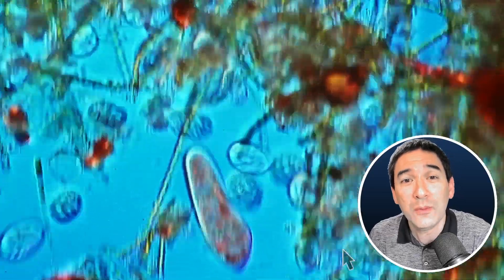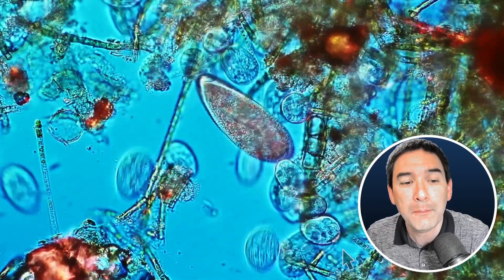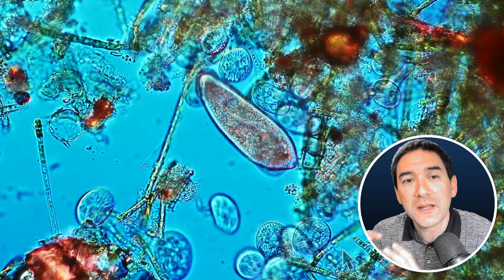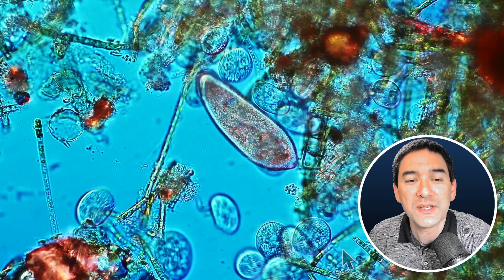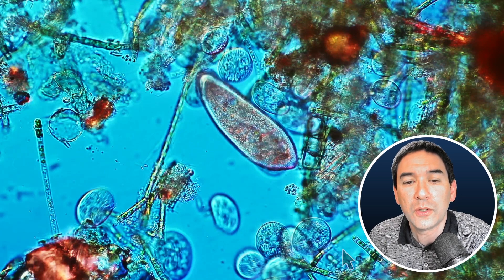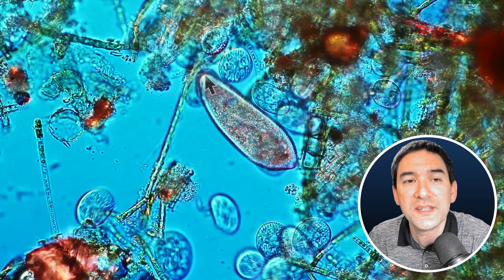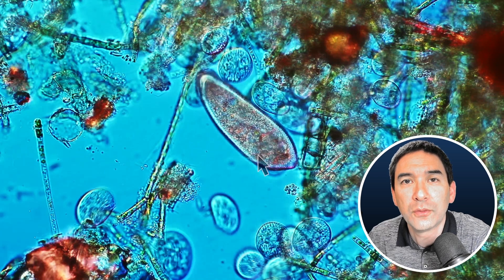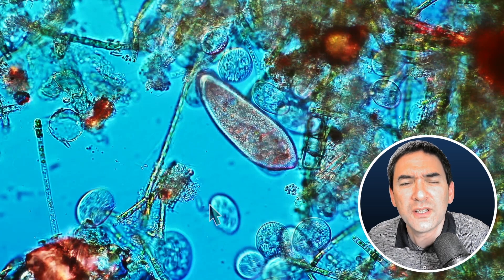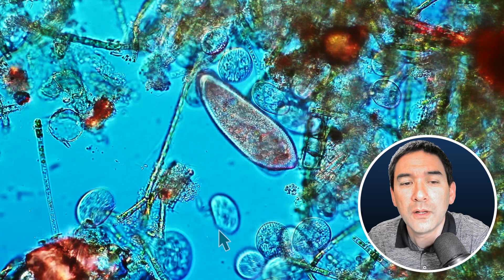So what I would like to do now is illustrate this using those protozoans here as well. You have to understand that each cell is surrounded by a so-called cell membrane, and those cell membranes are actually quite thin. The cell membrane is always on the outside of a cell. This is again our paramecium from before. Over here we've got some other protozoans, and the cell membrane is on the outside. Now you're going to say, actually I can see it quite well, because there's this dark line right at the border.